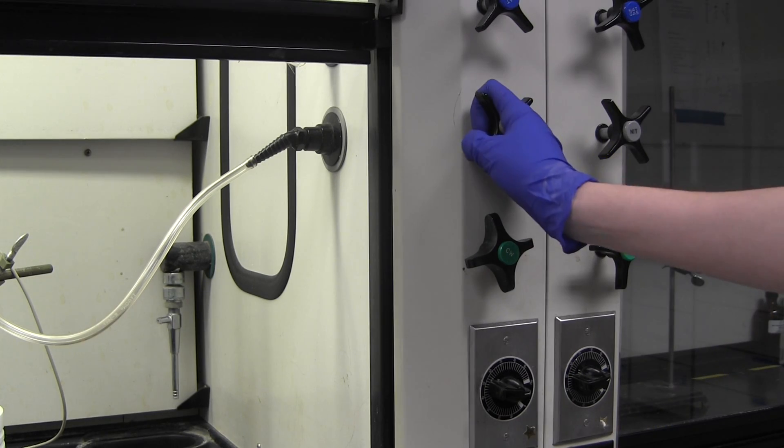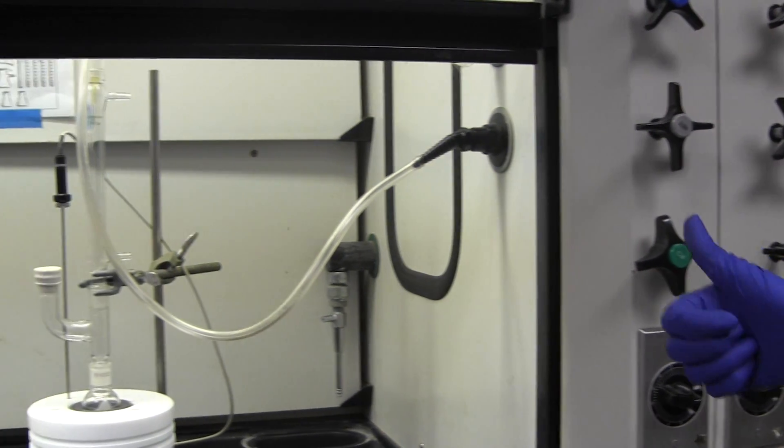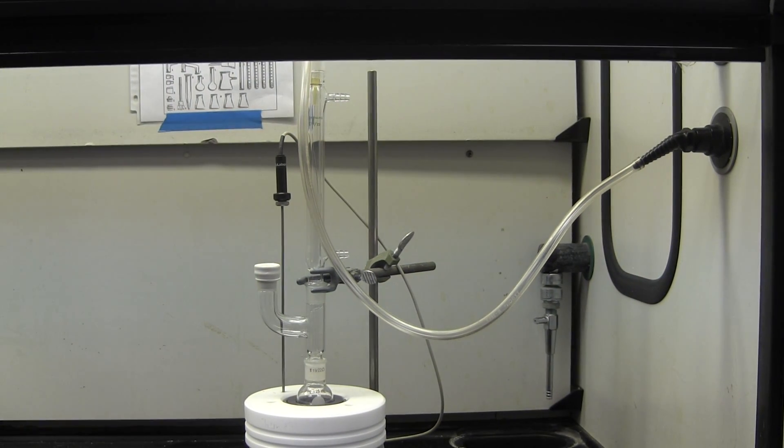Open the valve and allow nitrogen to run through the setup for at least a minute. The nitrogen will flow into the apparatus and push out the air, which contains both moisture and oxygen.